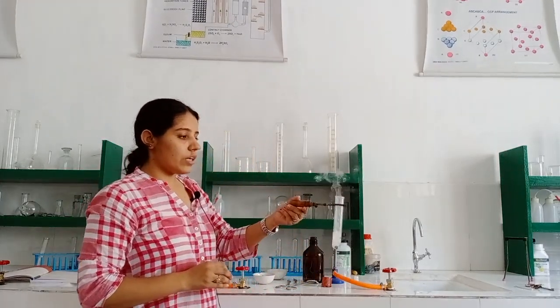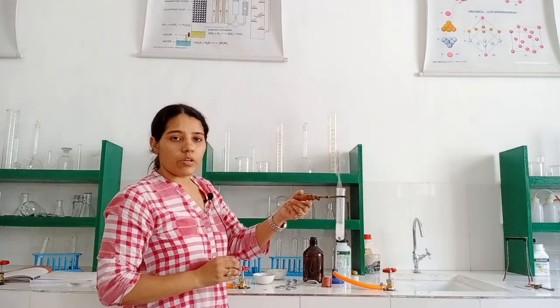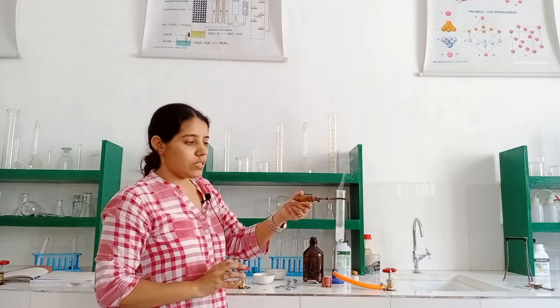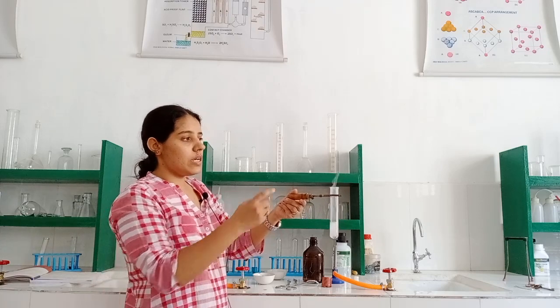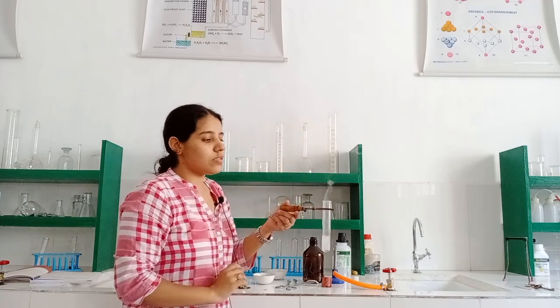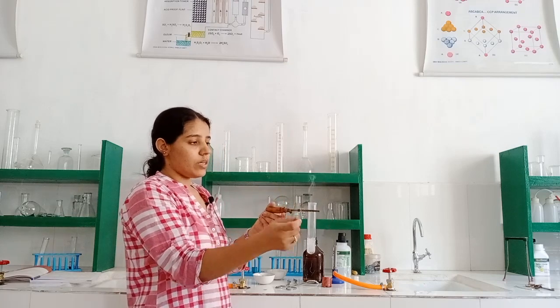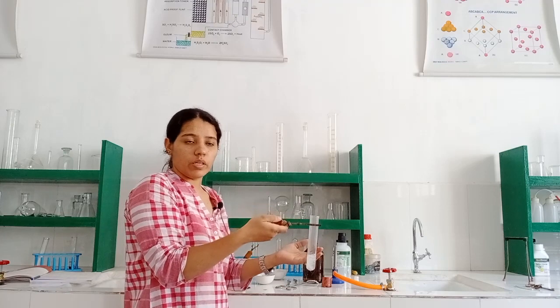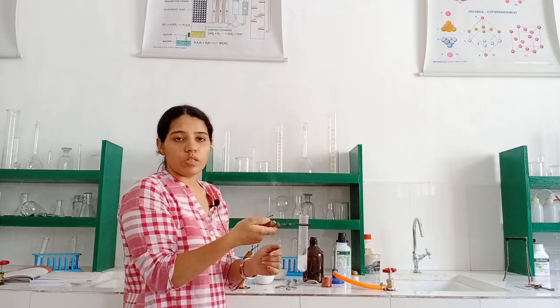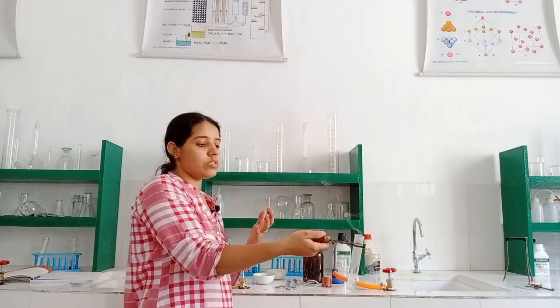So it is an instant reaction. You can see the zinc has reacted with the hydrochloric acid, and it displaces the hydrogen from the hydrochloric acid, and the hydrogen which is displaced fumes out in the form of hydrogen gas. Okay, how can we test that this is hydrogen gas? What we have to do is burn a matchstick and move it near the test tube. What you will observe is a pop sound near the fumes, which confirms that this is hydrogen gas, because hydrogen gas burns with a pop sound.